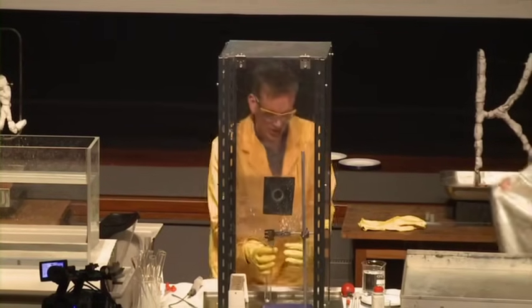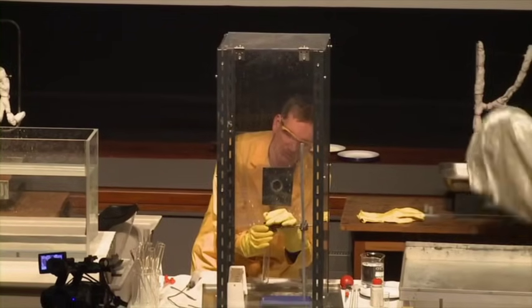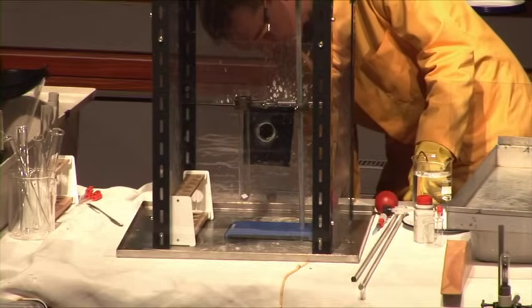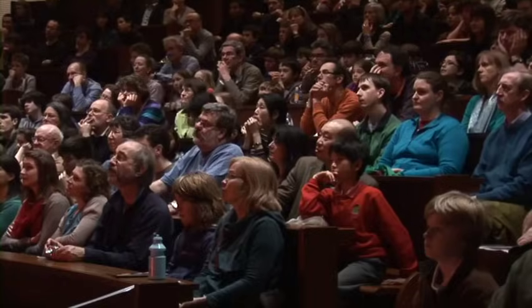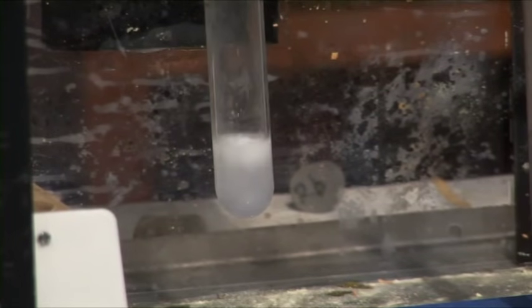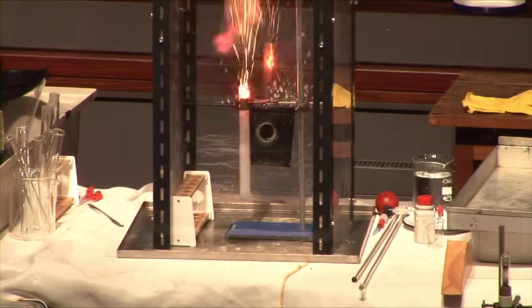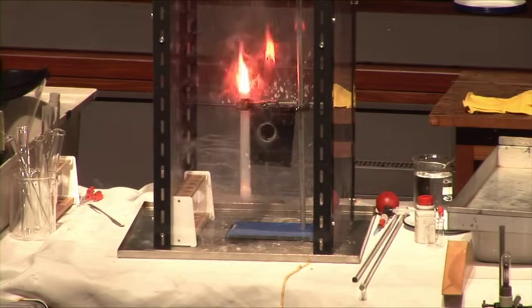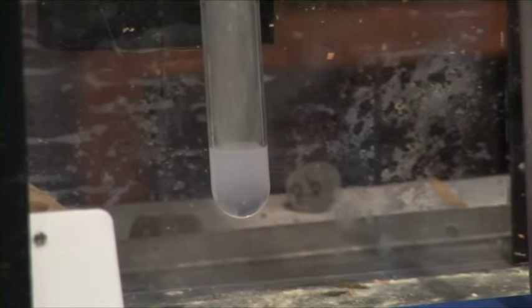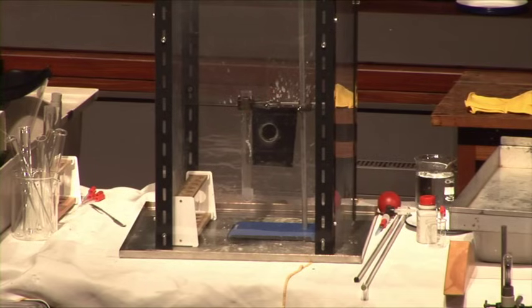Now again, it's the same quantity of metal. But does it react any more vigorously? I'm going to add the same quantity of water. So the sodium — certainly a lot more violent than the lithium. In fact, it caught fire. Notice the yellow color — this is the color characteristic of excited sodium atoms. So the sodium was clearly having a good time there.